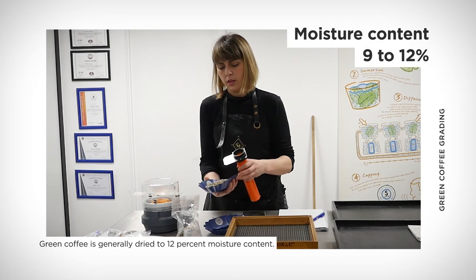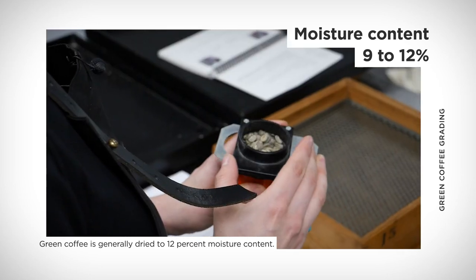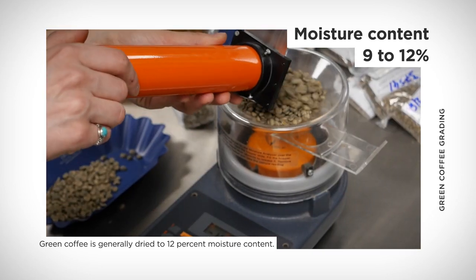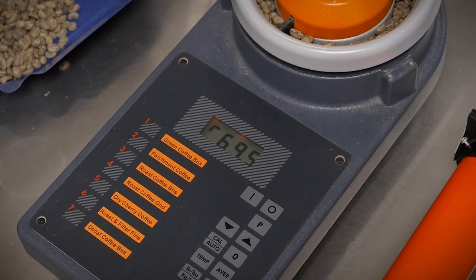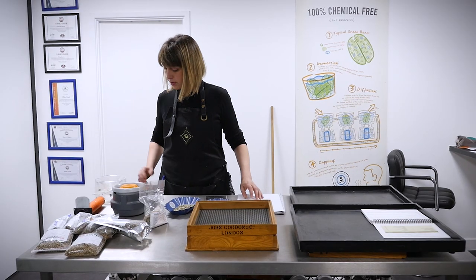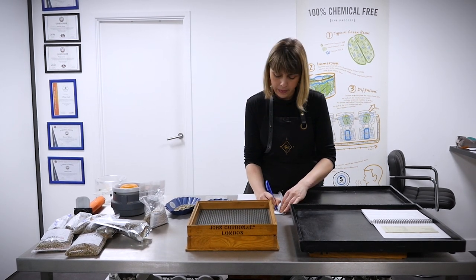The first thing I do is take the moisture content, because I need to understand if it's within the acceptable range. That range is around 9 or 10% up to 12%, and then there's density. Density can be used by roasters to understand how to write their curves or what to expect within the roasting process. If the moisture content is out of that range it's going to be difficult to roast, and you're also not going to have as much consistency — you can predict some issues with the drying process back at origin.